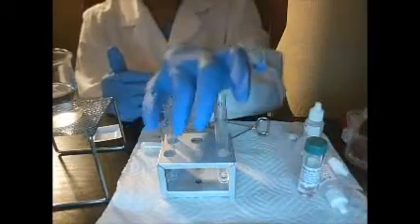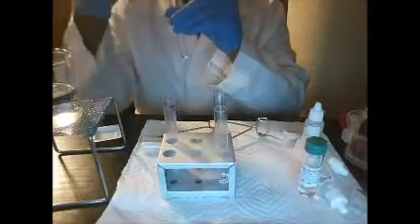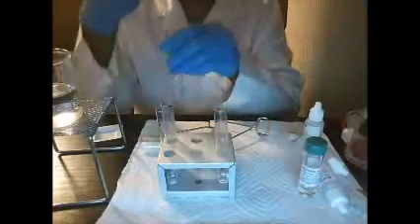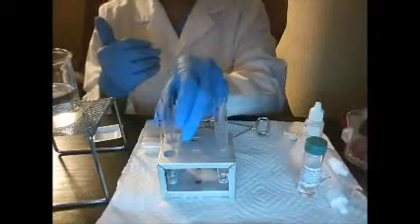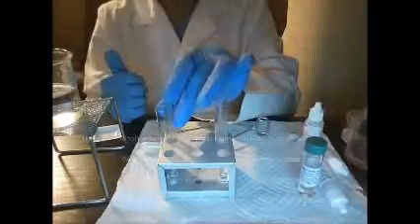Okay, and this is test tube 5. Smells like a pear. I have a pear scent to that one. And test tube number 6. Like a mint wintergreen. Smells really nice. Okay, and we'll have test tube number 7. It also smells like a mint wintergreen scent as well. Okay, and this is the end of our experiment. Thank you.